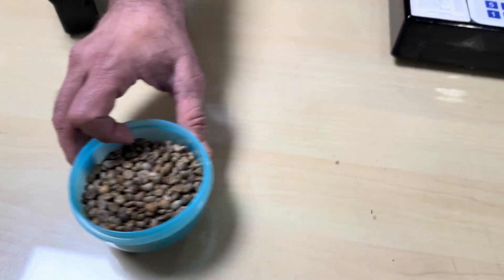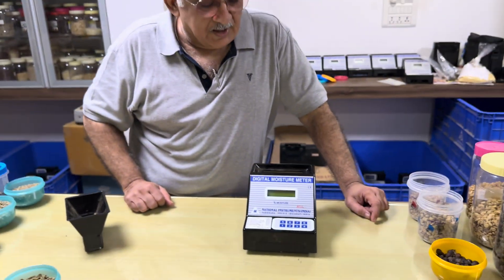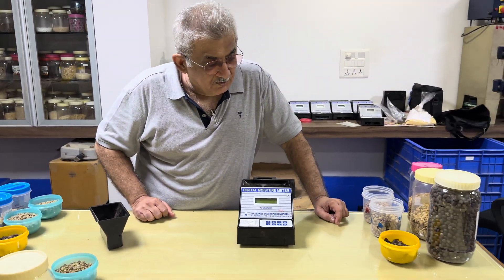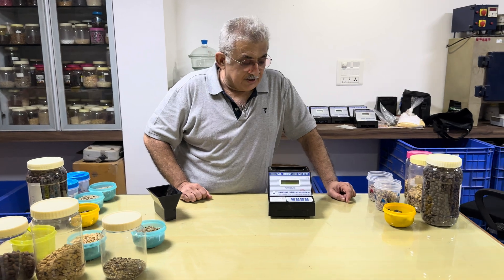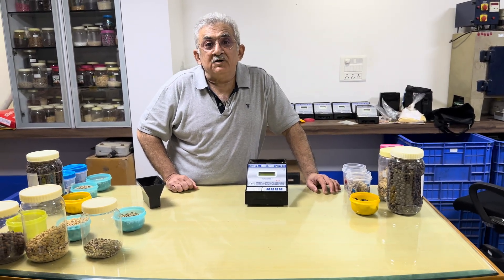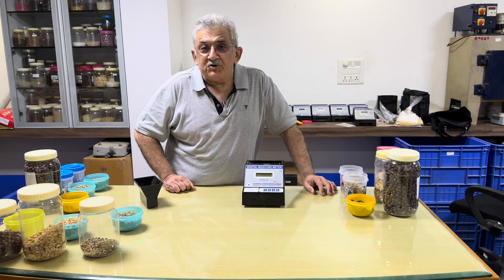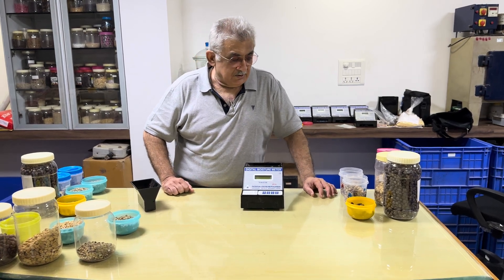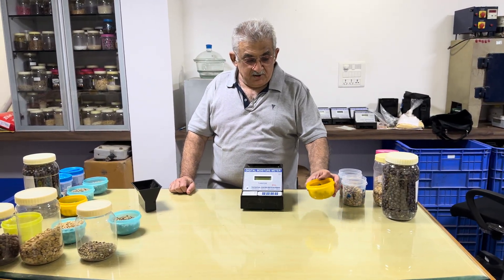Now I will explain and demonstrate how you can measure the moisture content in these 3 different forms of coffee using our moisture meter. First we will take a cherry.